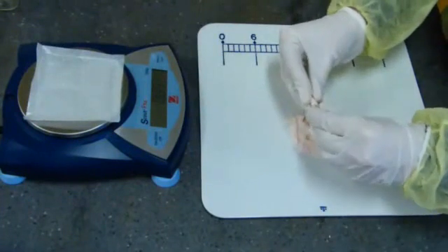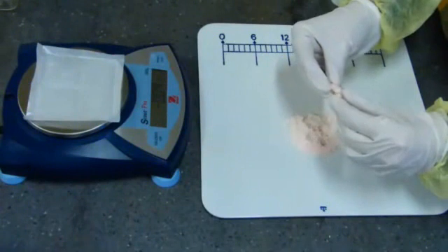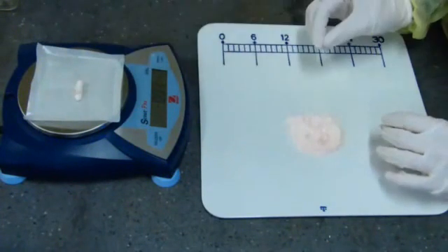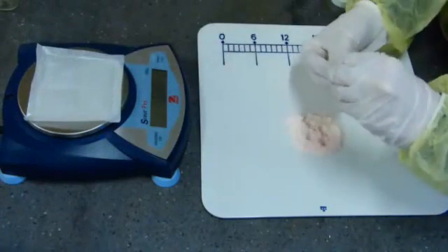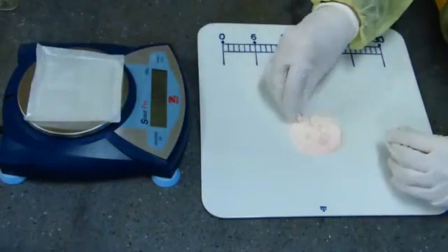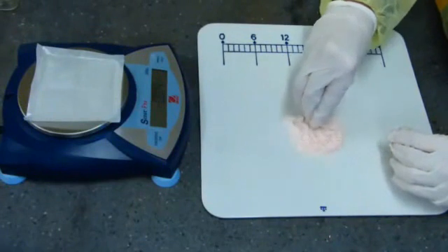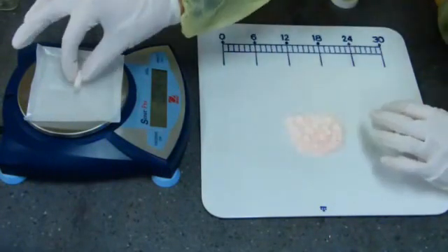If the capsule is too heavy, remove the head and empty a small amount of powder back onto the pill tile. Replace the head and reweigh the capsule. If the capsule is too light, remove the head and punch more powder into the capsule from the pill tile. Replace the head and reweigh the capsule. Repeat this process until the weight of the capsule is accurate.